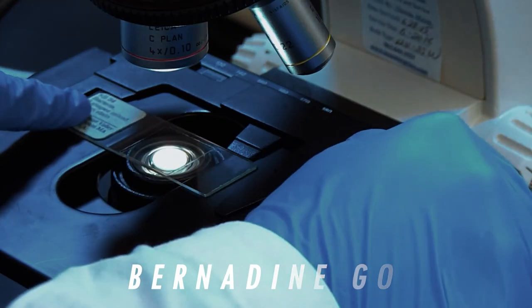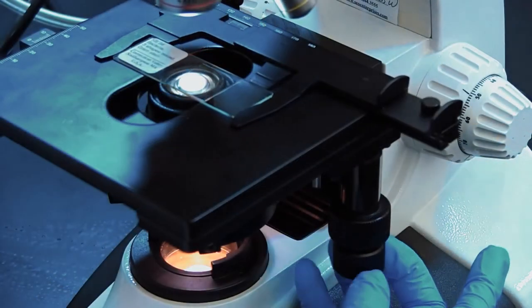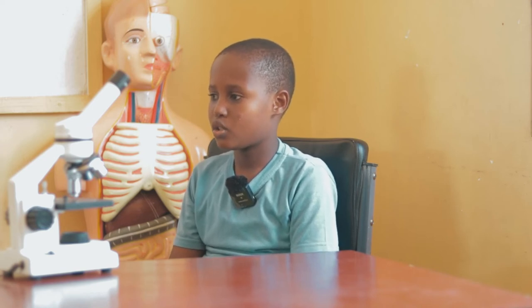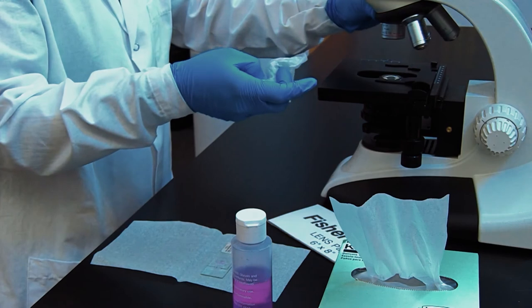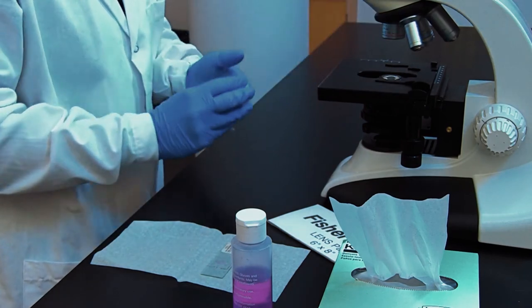Glass slides are flat and thin pieces of glass that are arranged for placing specimens on the microscope. These glass slides should be handled carefully to avoid breaking. Always use special lens paper to clean up the lens, and keep your microscope in a clean and dry place.